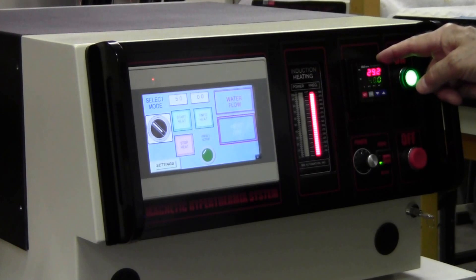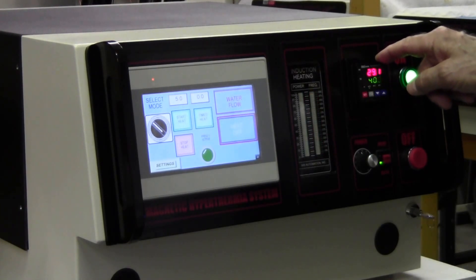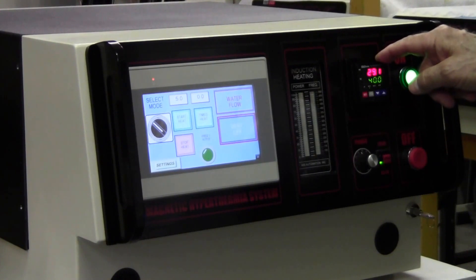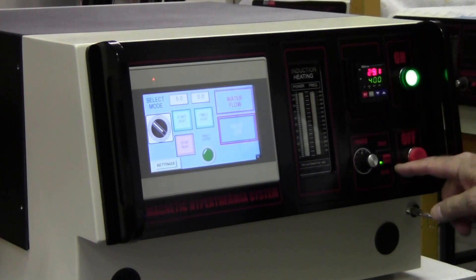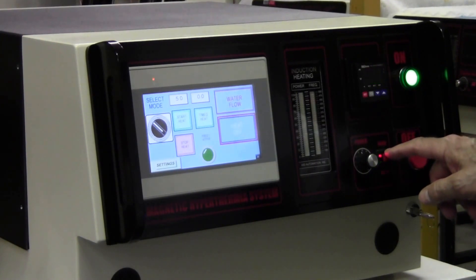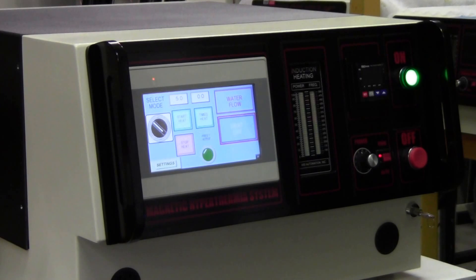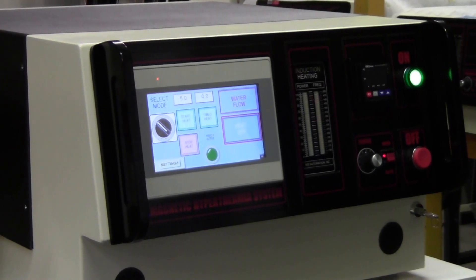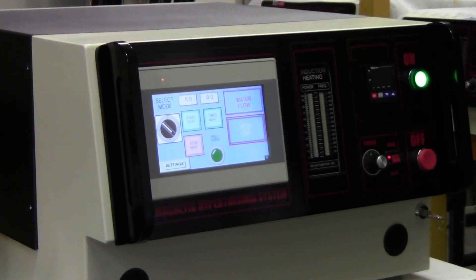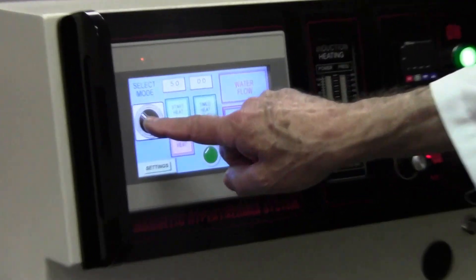Then you turn on the temperature controller, and the temperature controller is useful if you want to maintain a given temperature of the nanoparticles that you're trying to heat. But initially we'll heat in manual control just for demonstration purposes.